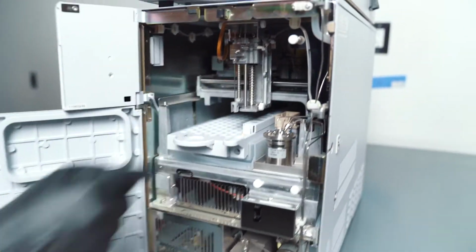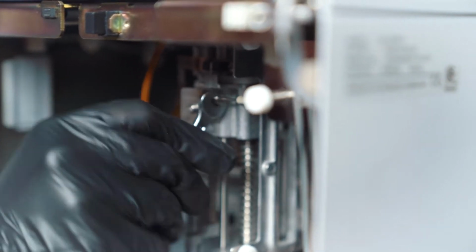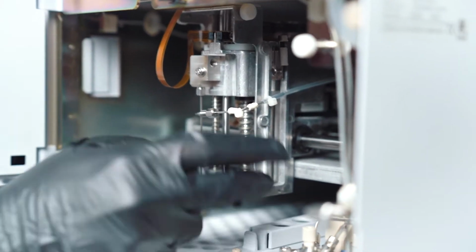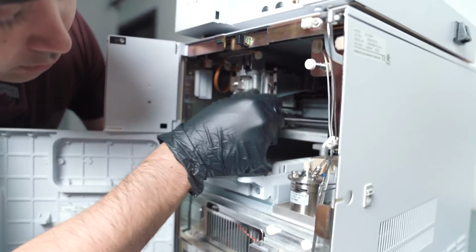So there you go. Now, the next thing you're gonna notice is there's a loop right here. I think it's a number 6 wrench. You can unscrew this guy. So let's get in there. Okay. So there you go. If you look back here, there's a little rectangle that the loop needs to go into. Make sure your loop passes through that rectangle, because that's going to make sure that the motion of the loop is in the right spot when the auto sampler head is moving around.